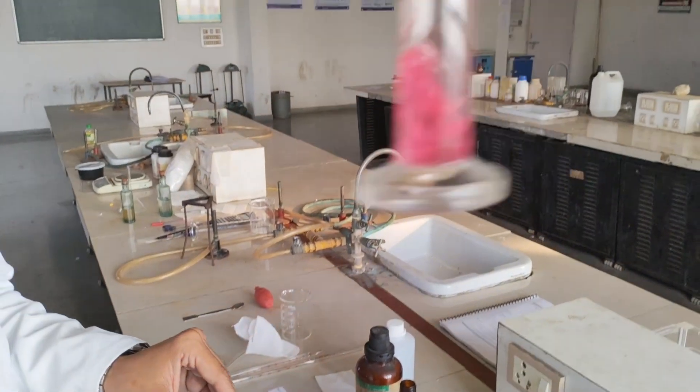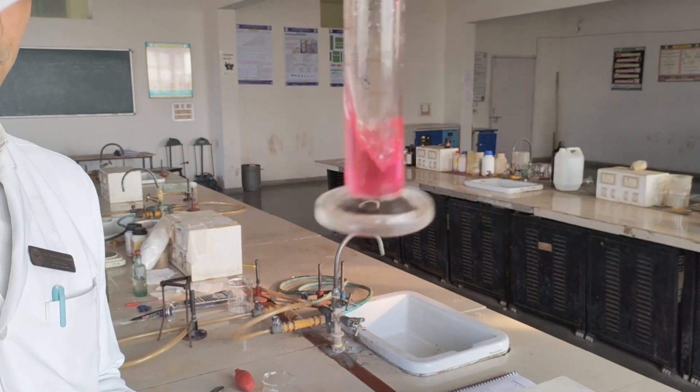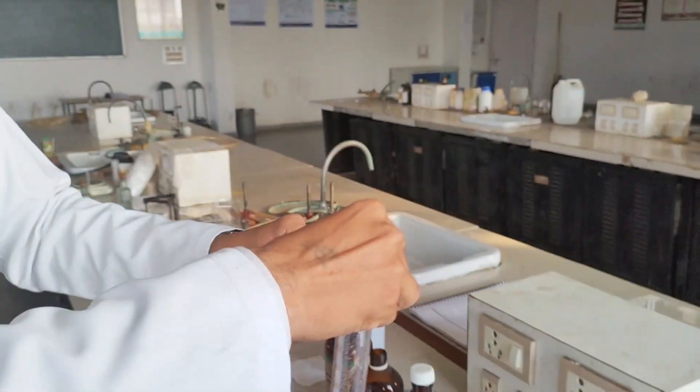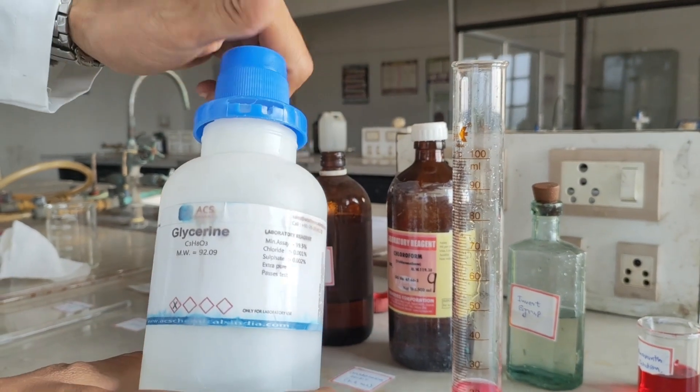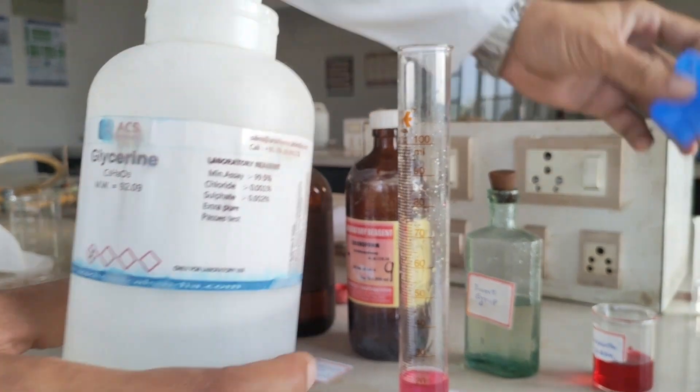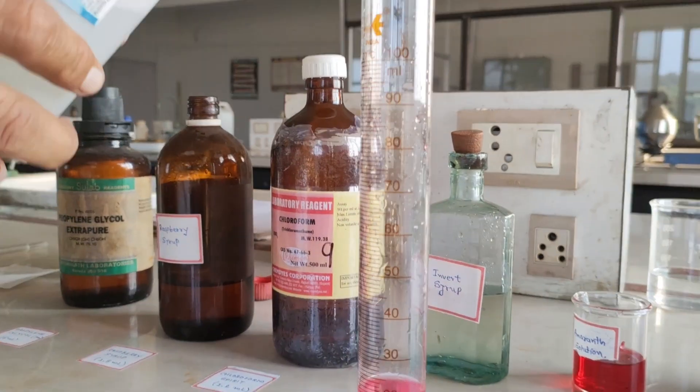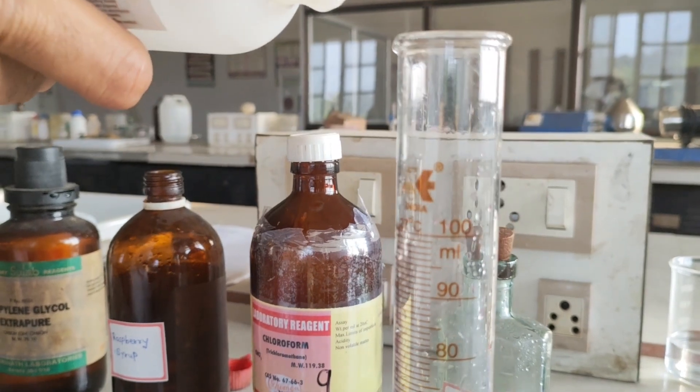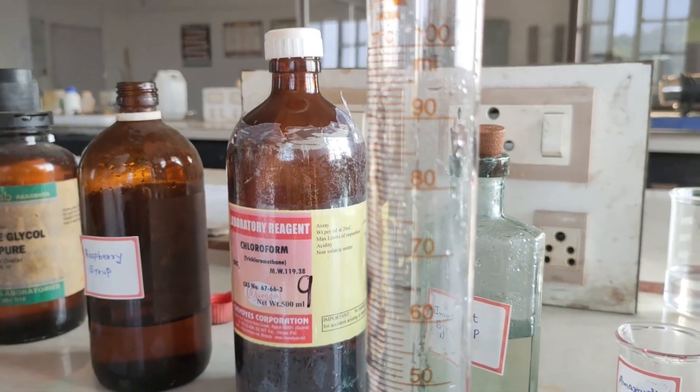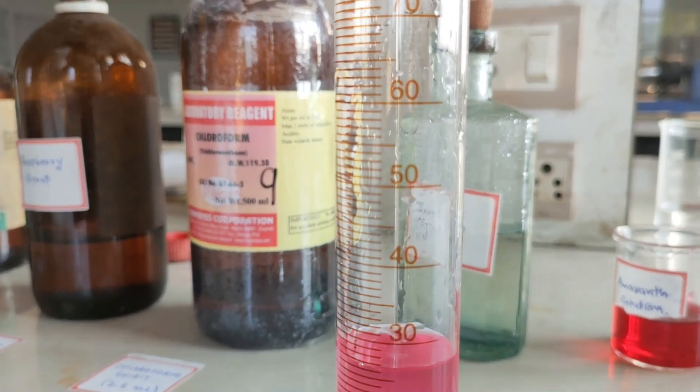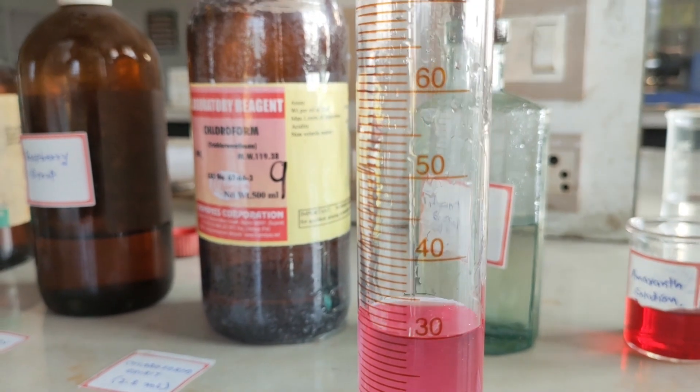Now we are going to make up the volume using glycerin up to 60ml. Add it slowly.